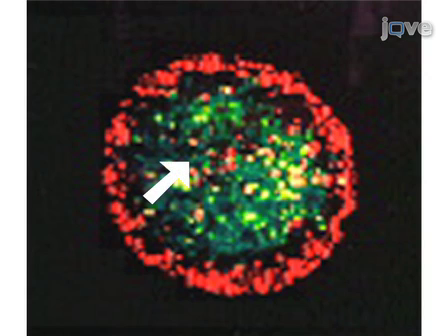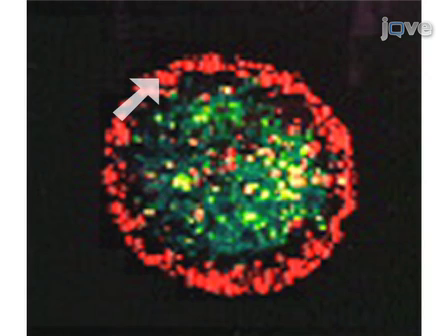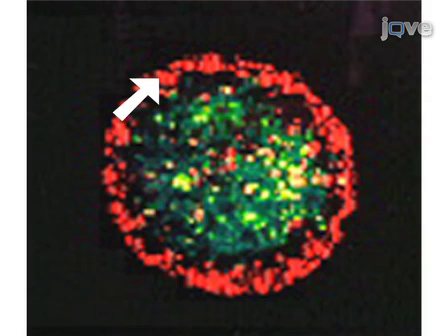Two N-cadherin transfected L-cell clones expressing N-cadherin at their surfaces at a ratio of 2.4 to 1 were stained with the fluorescent membrane intercalating dyes PKH2 and PKH26, mixed in equal proportions, and cultured as hanging drops. In this example, the high N-cadherin expressing cells, pseudo-coloured green, are enveloped by those expressing lower levels of N-cadherin, pseudo-coloured red.